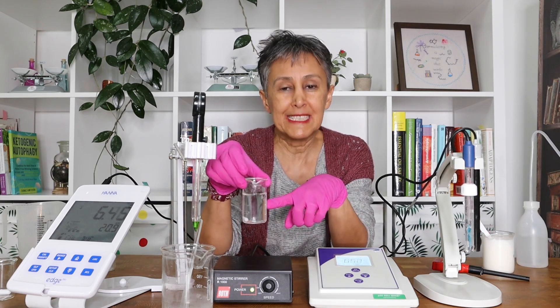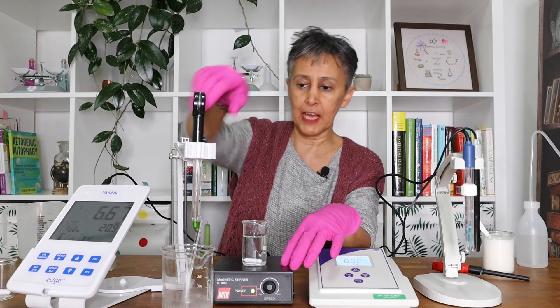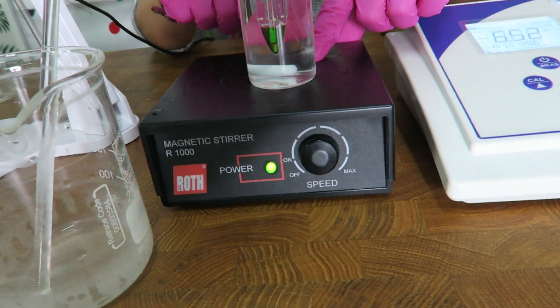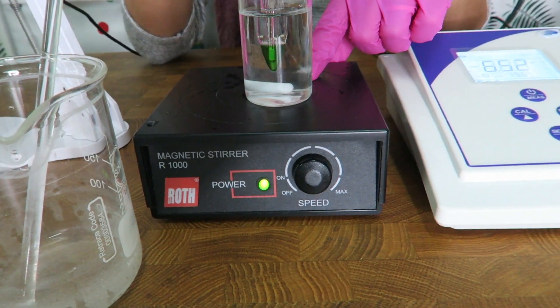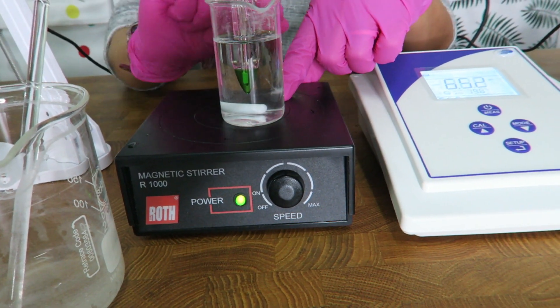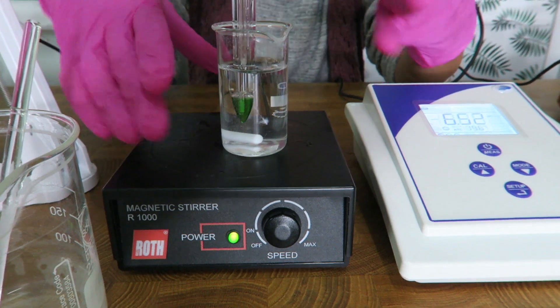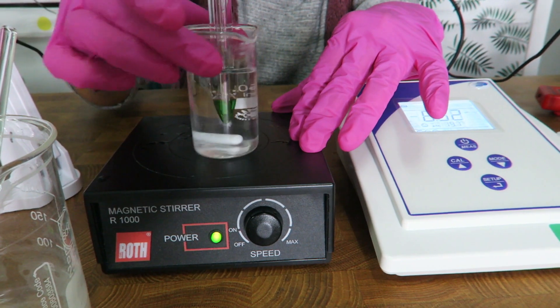When you want to measure the pH, go with the electrode into the sample. Your electrode shall not touch the bottom of your beaker — take care of that. Your electrode must have some space between it and the bottom of the beaker. The old-fashioned version of measurement requires you to create a current so that you measure the pH accurately.